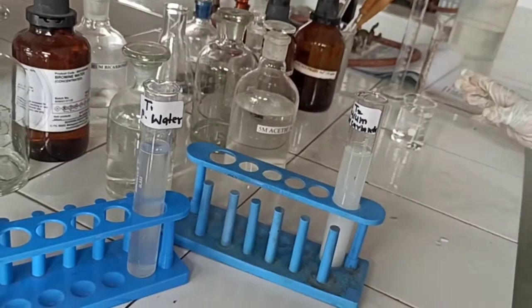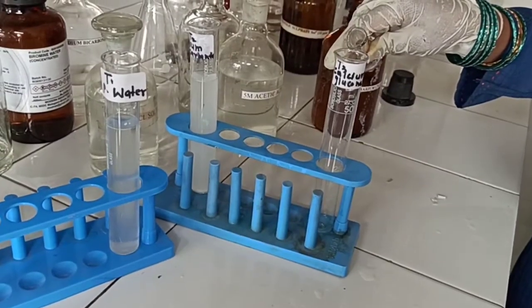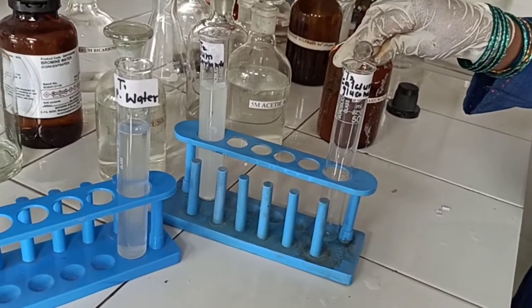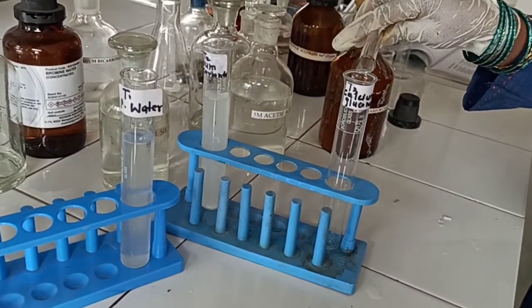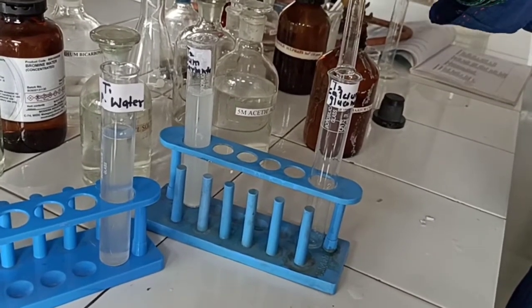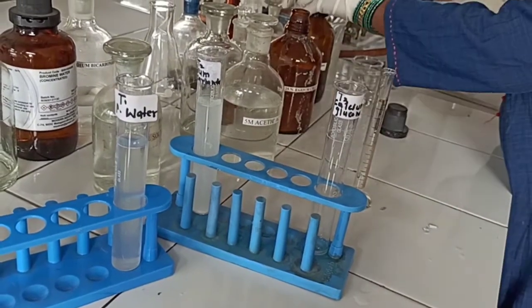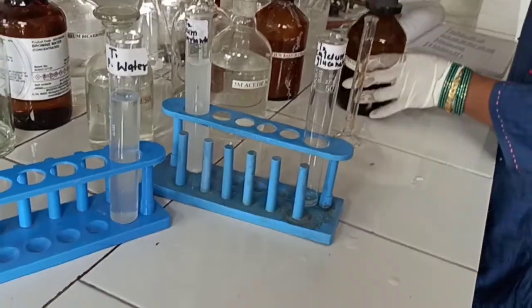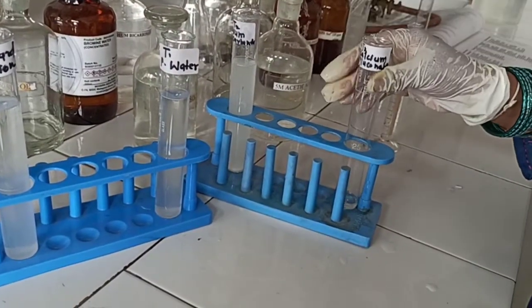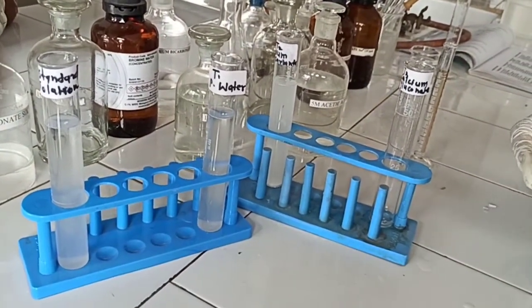To prepare test solution T3 for calcium gluconate, take 1 ml of 25% weight by volume barium chloride solution in a labeled Nessler cylinder. Add 1.5 ml of ethanolic sulfate standard solution, then add 1 gram of calcium gluconate.